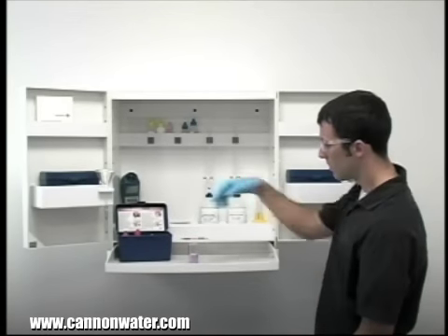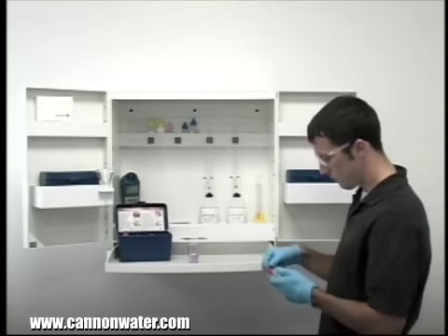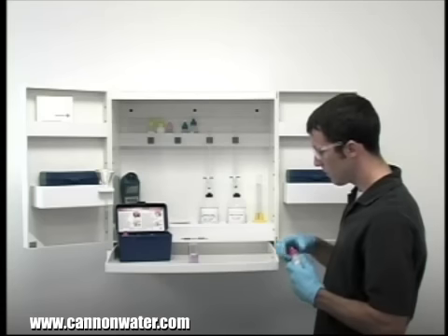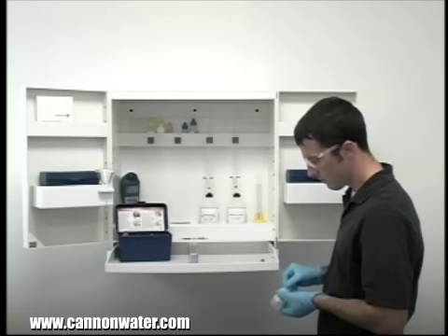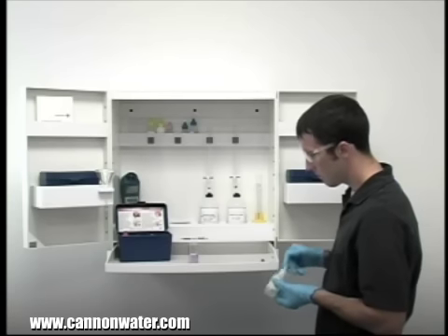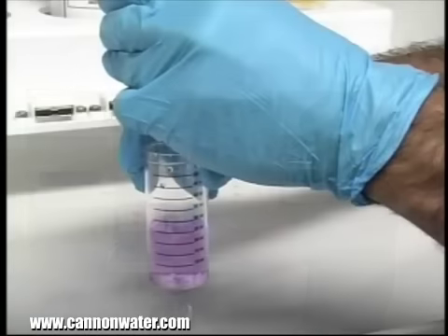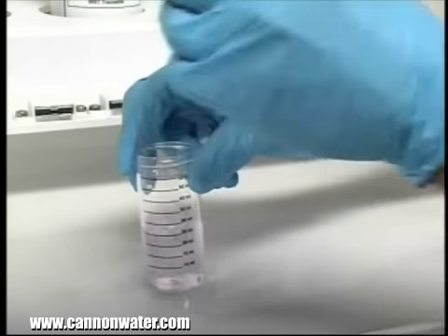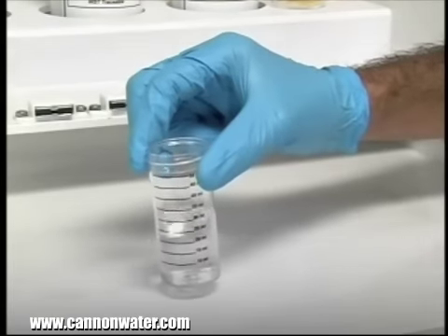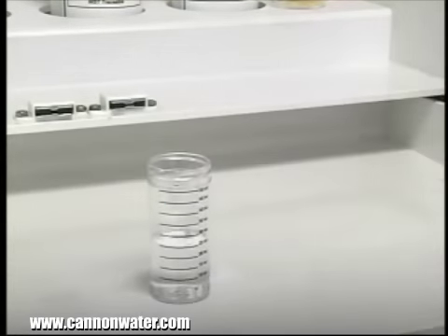The next step according to the endpoint ID procedure is to perform the titration. Each bottle of titrant is labeled with the equivalency and sample size it was manufactured for. It's important to make sure you have the proper titrant and the proper sample size for this titration. The bottle of titrant contains a dropper tip to ensure a consistent drop size. After the addition of each drop of titrant, you want to swirl the vial to make sure the sample is properly mixed.